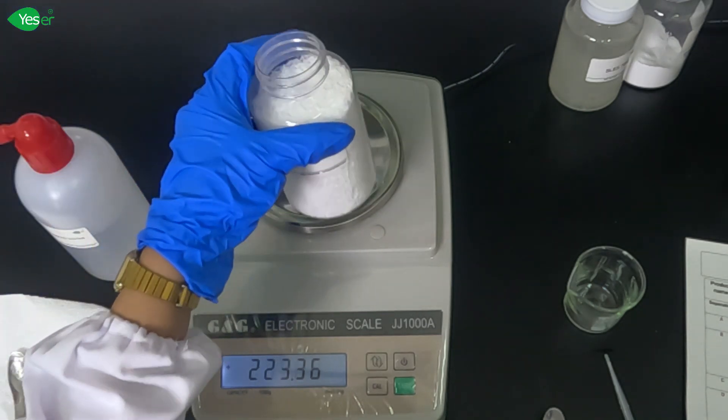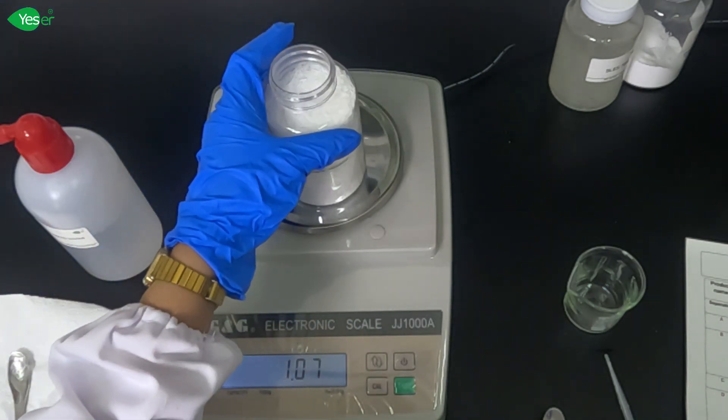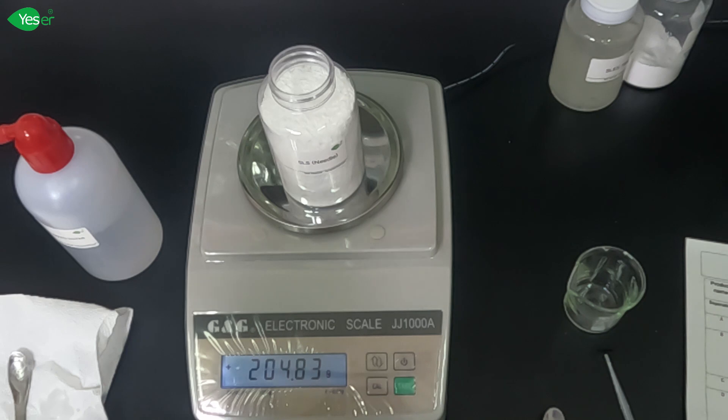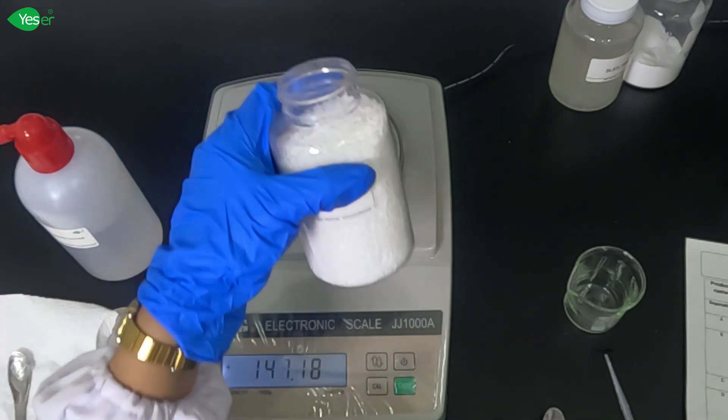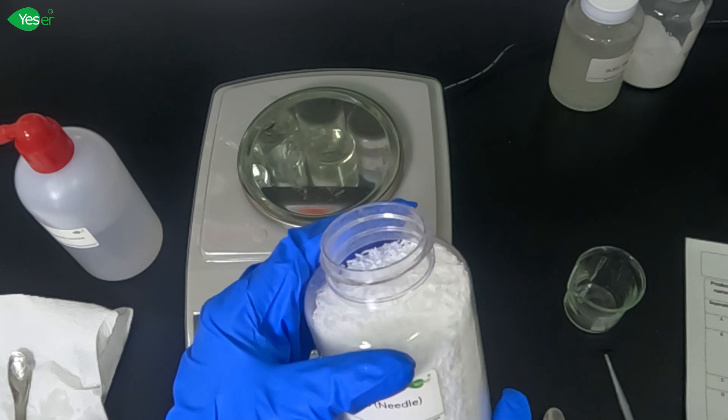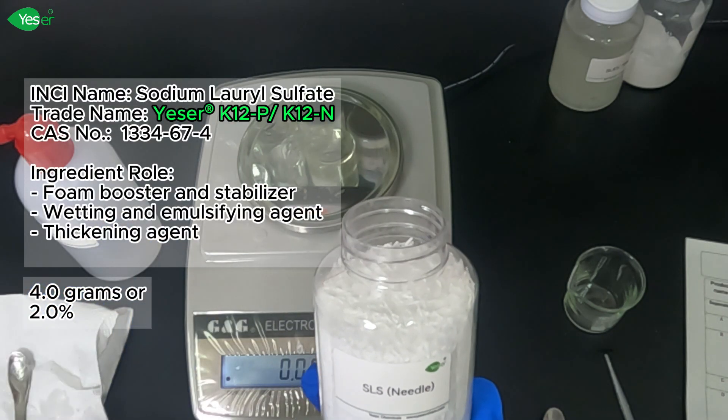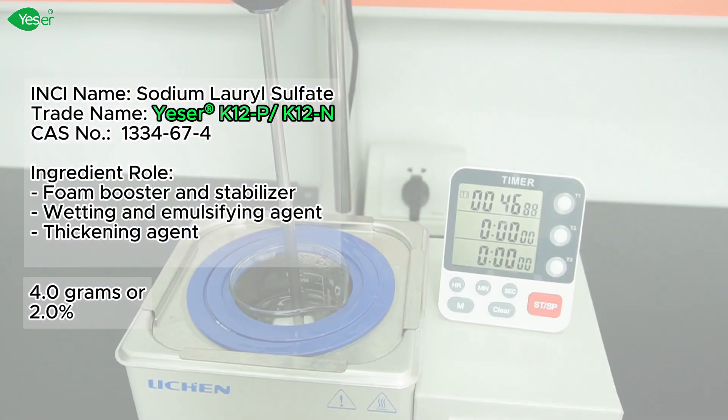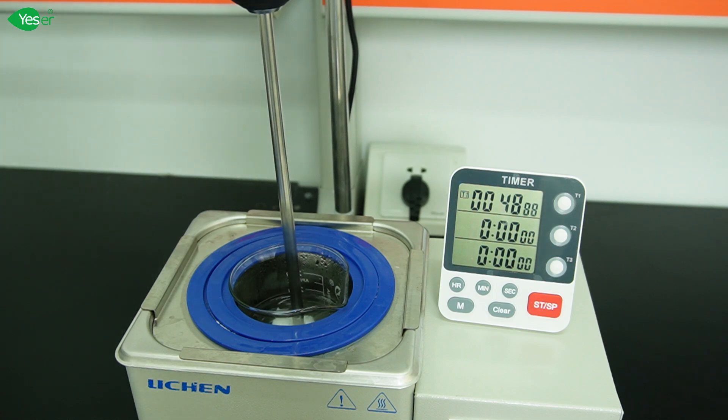Once dissolved, SLS molecules surround and encapsulate dirt and oils, forming micelles. These micelles then rinse away, leaving your skin clean and refreshed. This is why SLS is known for its excellent cleaning properties. We're going to add 4 grams of this, 2% for the formula.